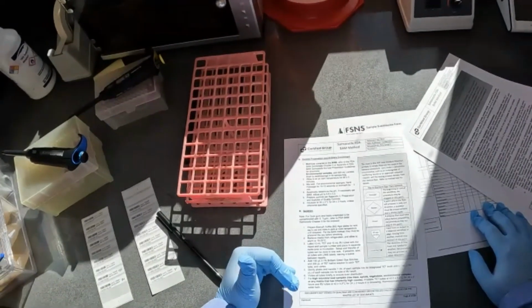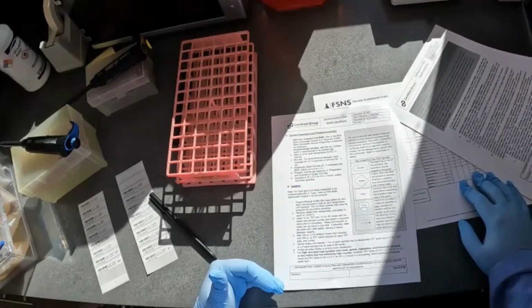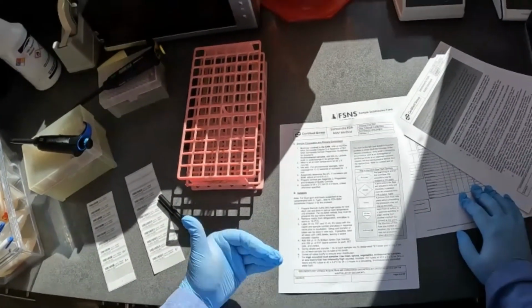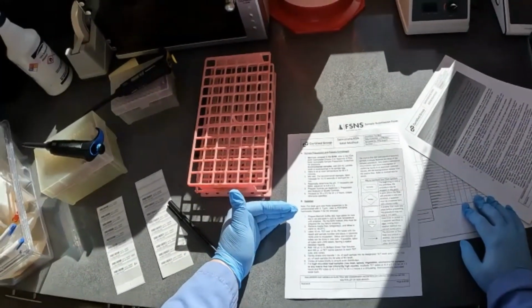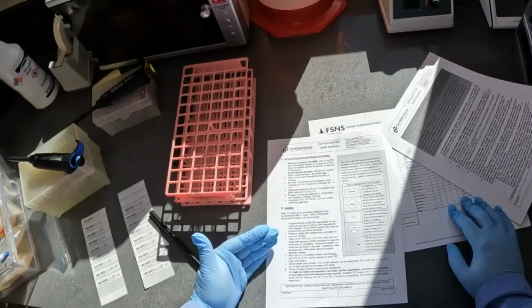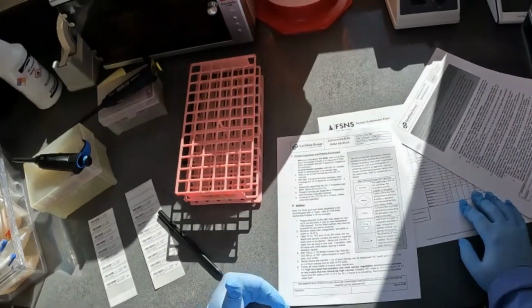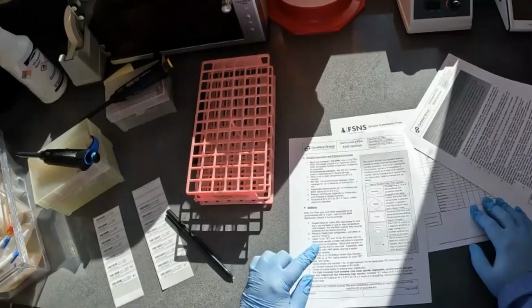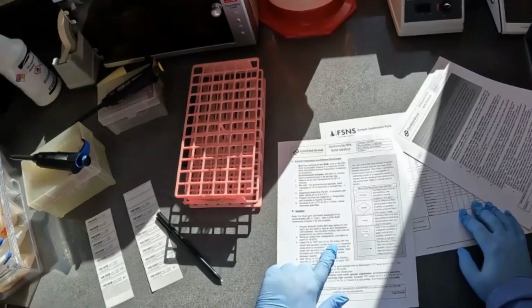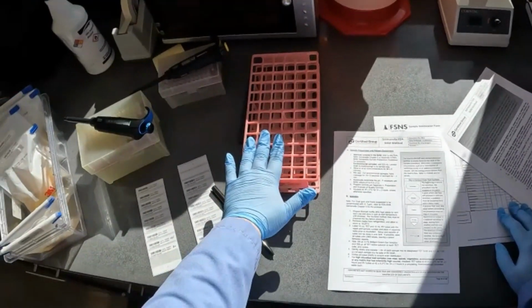And it gives you some information on how to get prepared for each section of the test. So you want to make sure that you prepare some plates because they have a short shelf life. Make sure that we allow all of our materials to come to room temperature. And then we're going to label our TET tubes and our RV tubes with the report and sample number. We're going to place those in a separate sample rack.